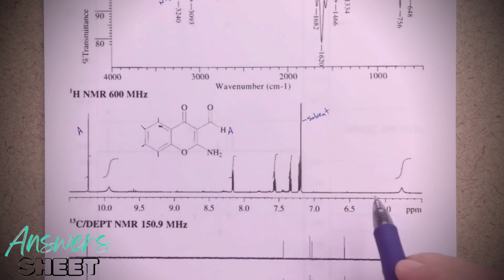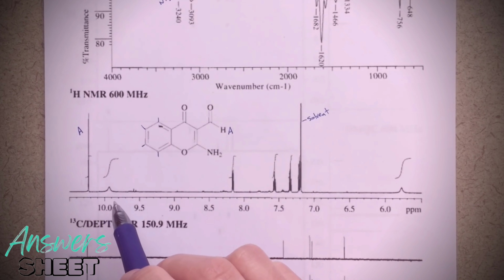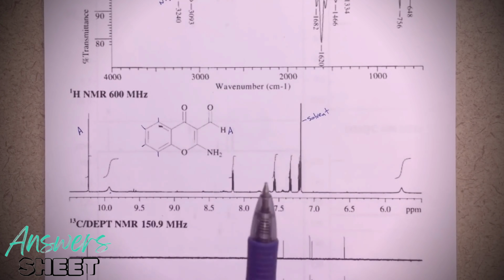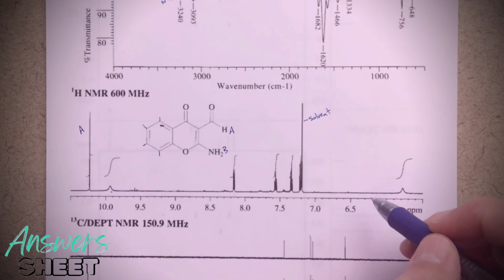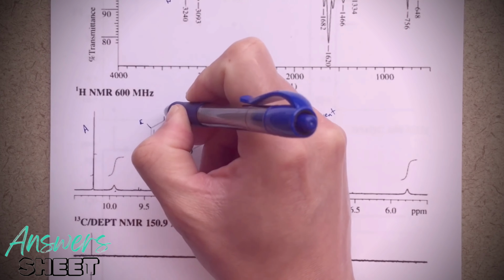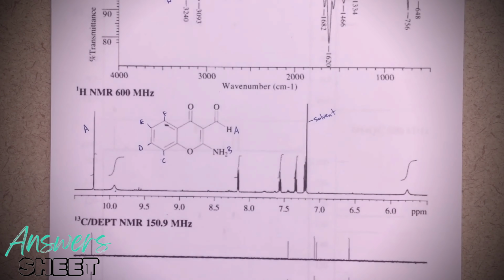For the NH2 peaks, I've actually got 2 signals, which is quite interesting. And we'll talk more about that as we move on. But I've got this peak here and this peak here. These are both for the NH2 group. Again, we'll talk more about how we get those 2 peaks a little bit later on. But we're going to call these B. We'll end up calling it B prime and B double prime. And then I labeled these as C, D, E, and F. So we'll be using these labels as we move forward.